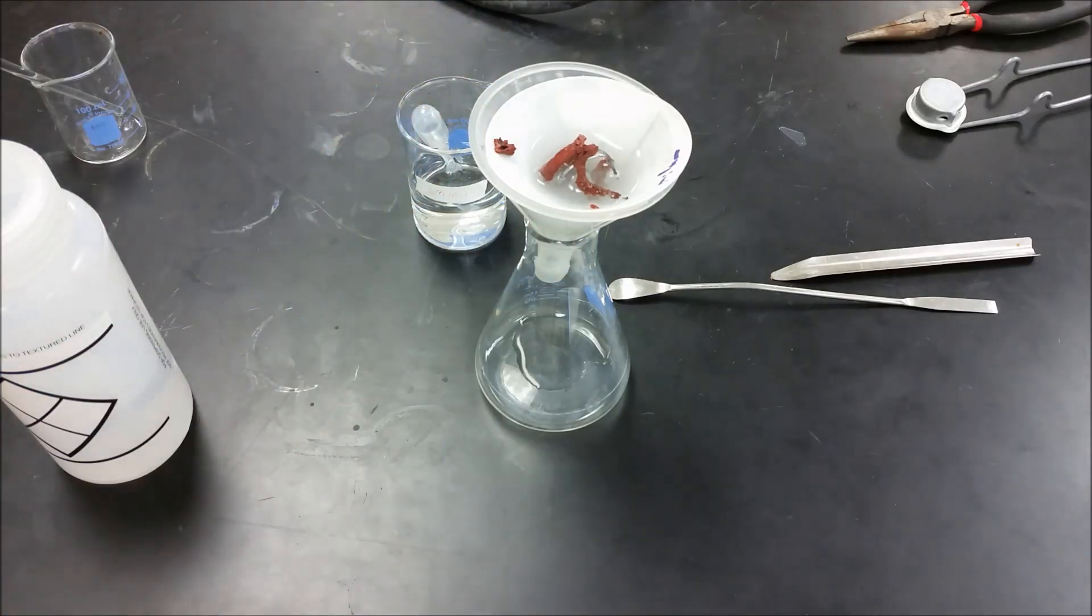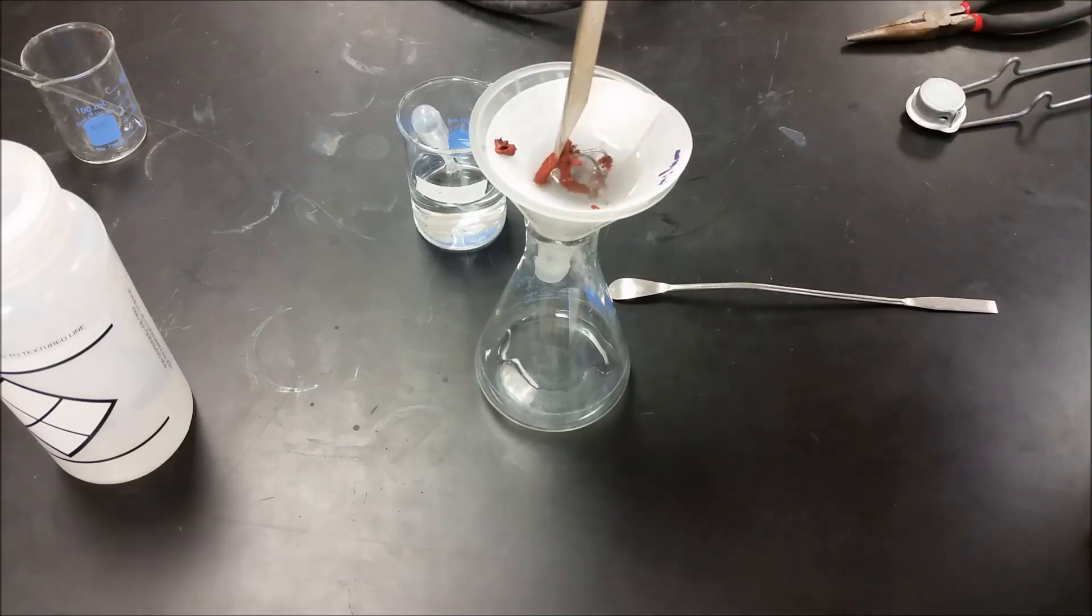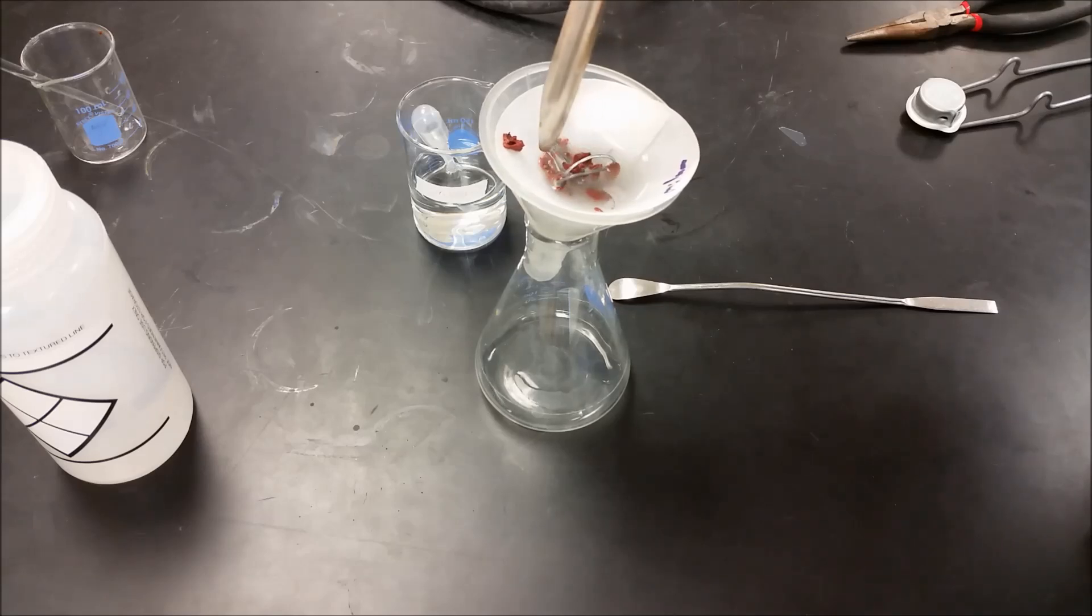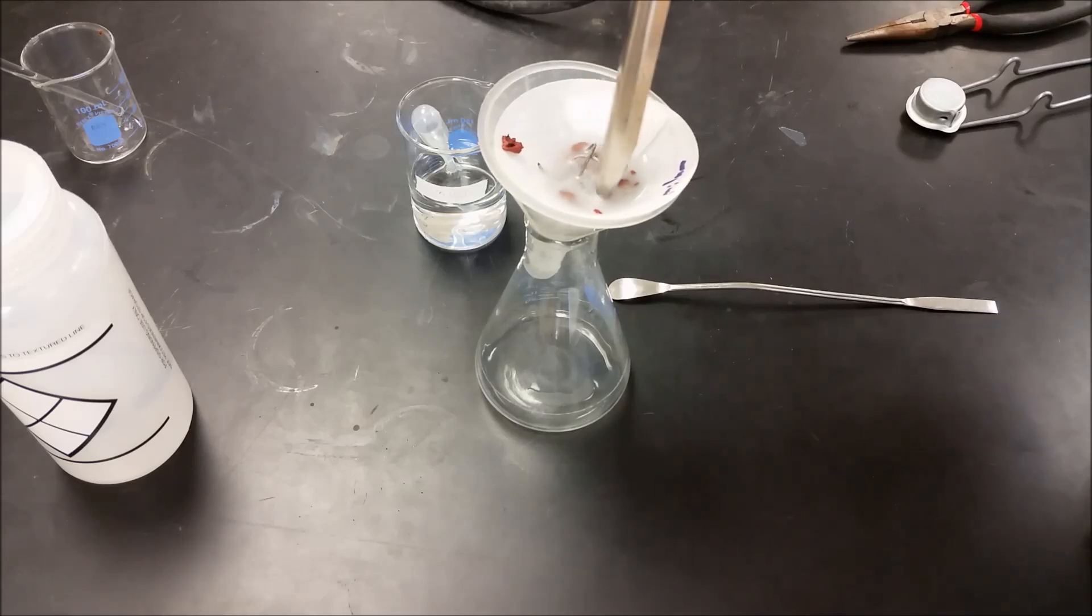It looks like we have a little bit of HCl going on there, we can see the hydrogen gas evolution. What we want to start doing is we now want to start scraping off the copper from the wiring. We want to separate that wire out so we can just remove it completely. And then we're going to rinse pretty decently here to get rid of all the salts that might be dissolved in this solution after we've had this initial run through for the filtration.